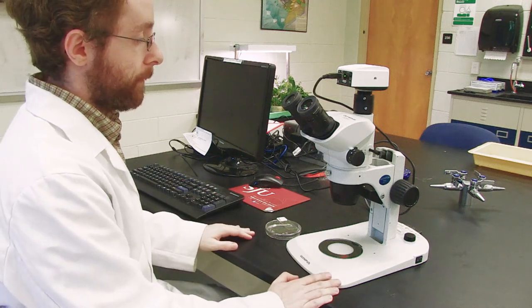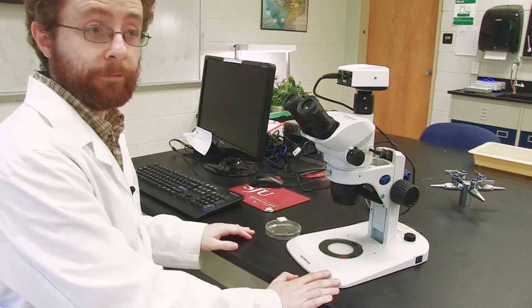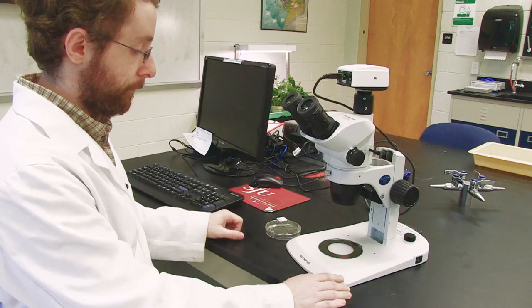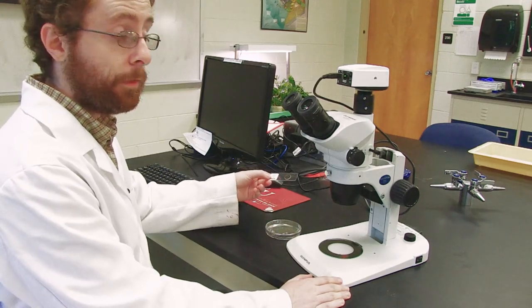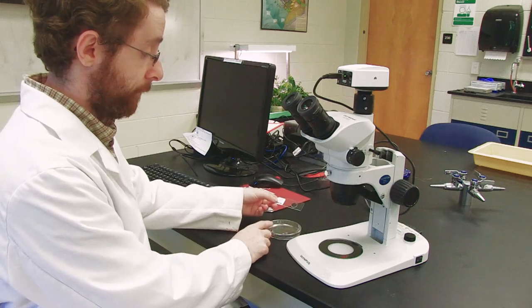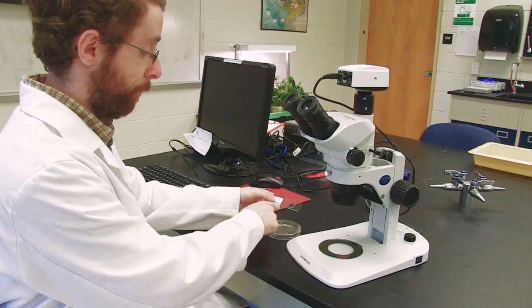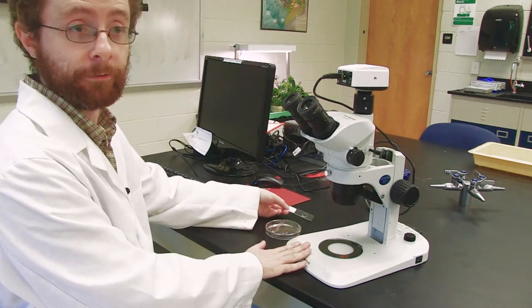The microscope that you'll be using today is the dissecting microscope. This dissecting microscope can be used to either look at slides or to look at specimens. In today's video, we'll see how both can be used with the dissecting scope.